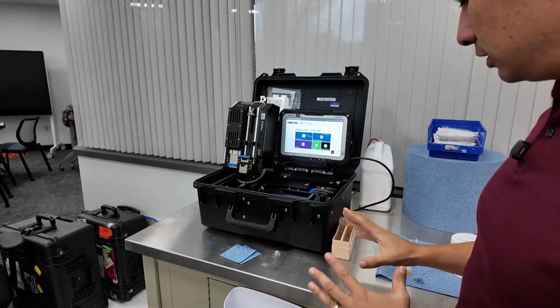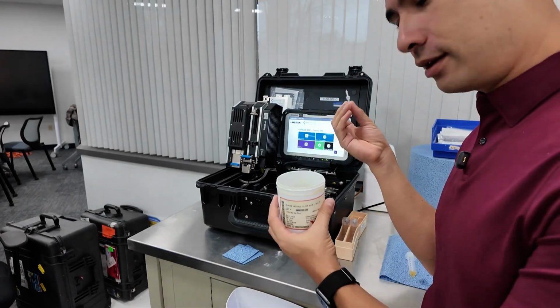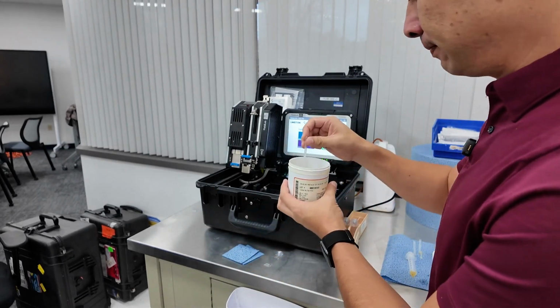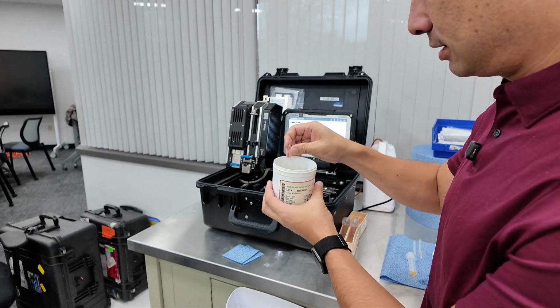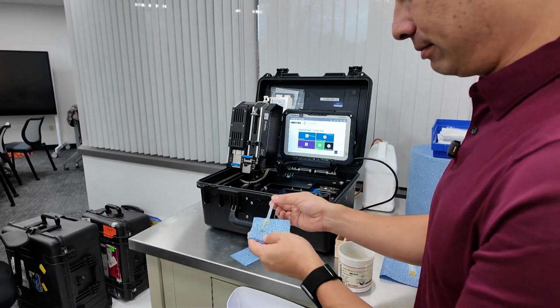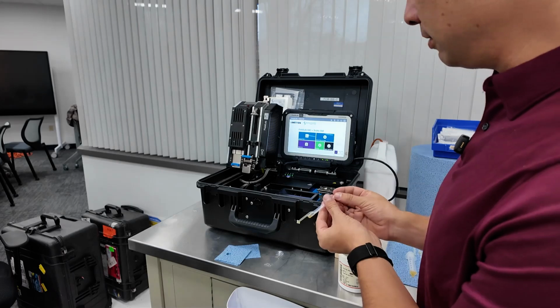Now, the process for this is actually pretty simple. So, got to take one of these. All right, so we're going to test some Valvoline engine oil. I haven't chosen this for any particular reason, right? But what we're going to do is just use this pipette. Okay, draw out a sample. Here you go. Now you might want to wipe it a little bit on here just to make sure that there's no excess. Okay, first thing, we're going to set up this unit.